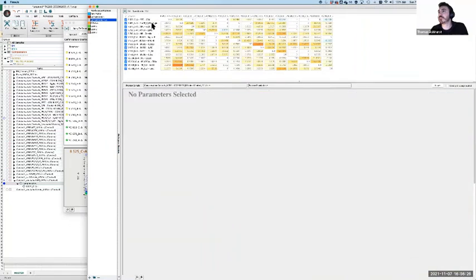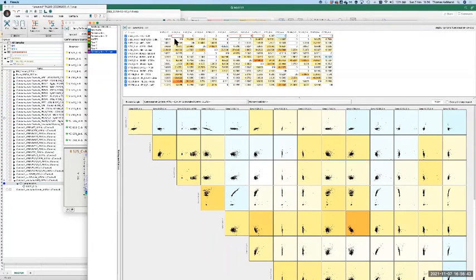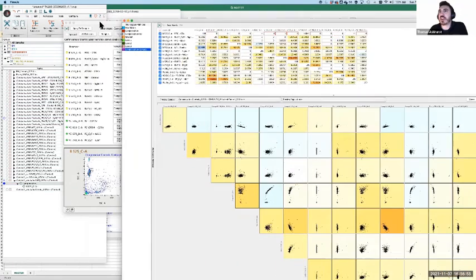Matrix. Yeah, so it's got the column, and then those I can just set to 0, it's actually most of them already 0, but there you go. Because those could all be 0 because it's not a relevant contribution. Not going anywhere, but the column should be accurate. So have you got a column that's showing the comp of all the dyes into FITC? Well, yeah, it should be this first one, but that doesn't look right.